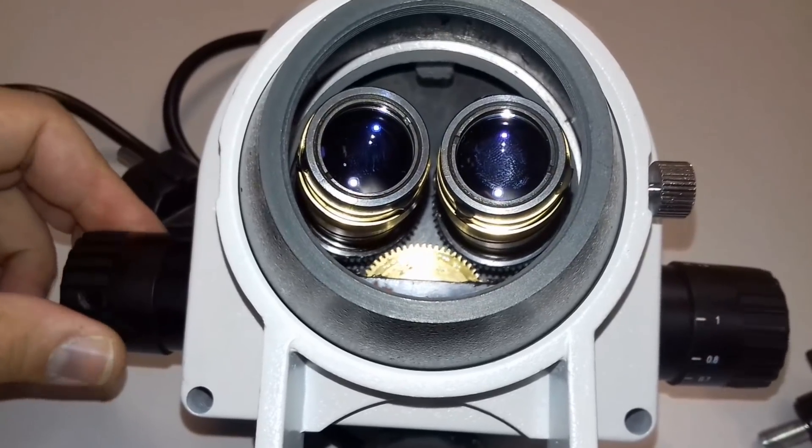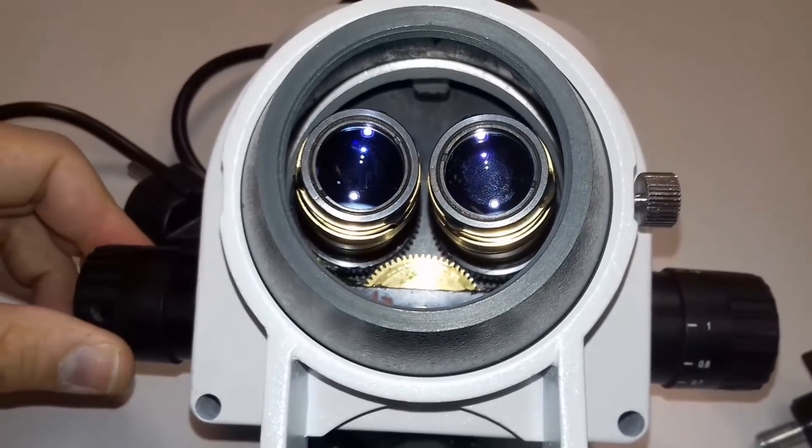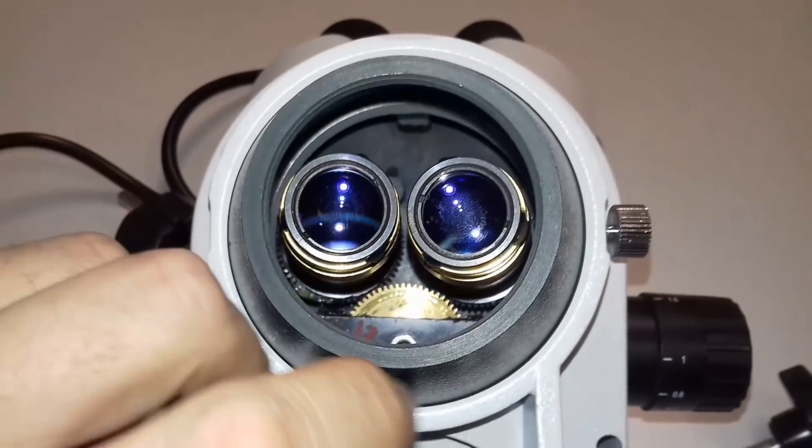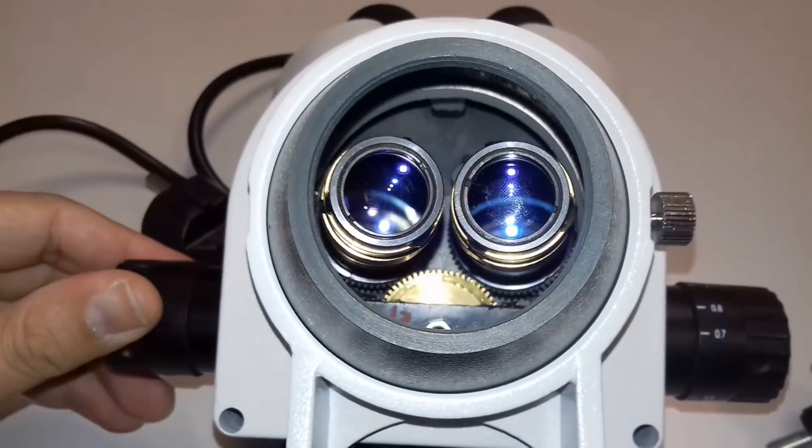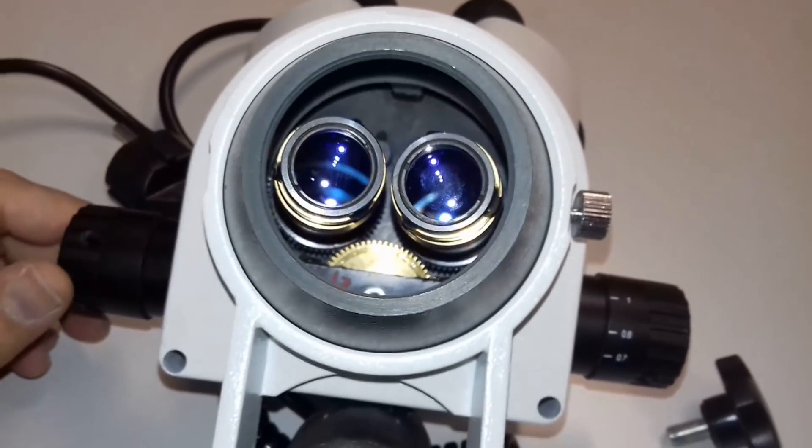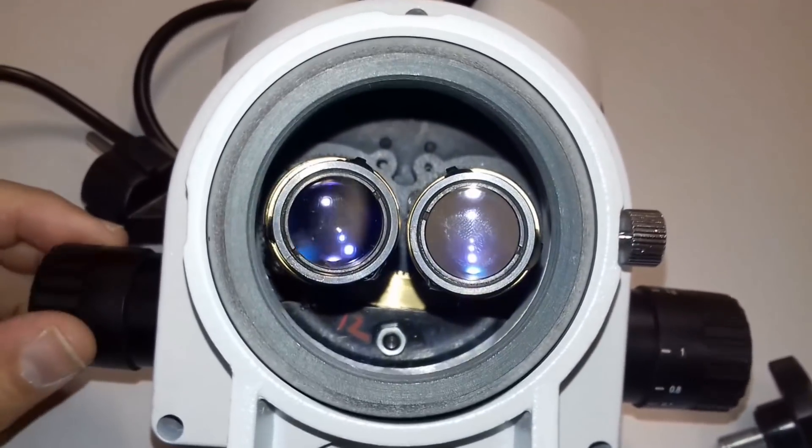Yeah, so that is basically the way that this works. And because of the lens elements moving back and forth, this is also the reason why there's a little bit of a focus drift, but that is really you can almost forget about this because it's so small. So you just have to refocus again.